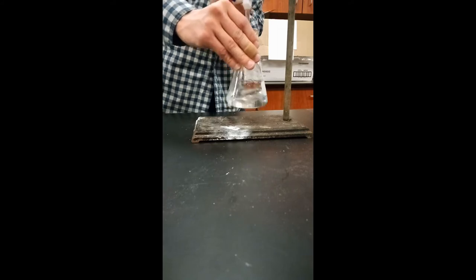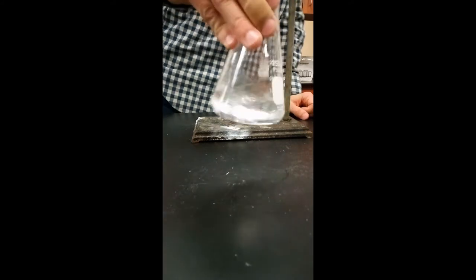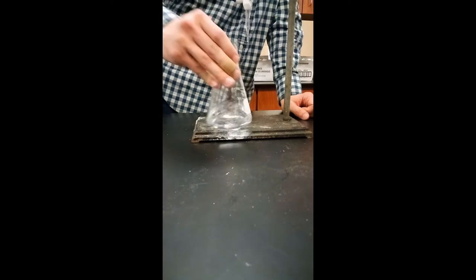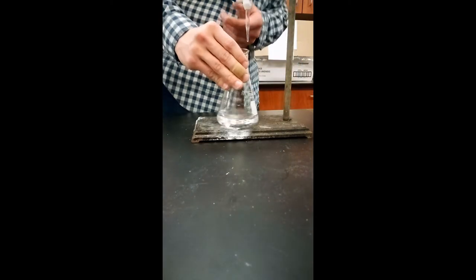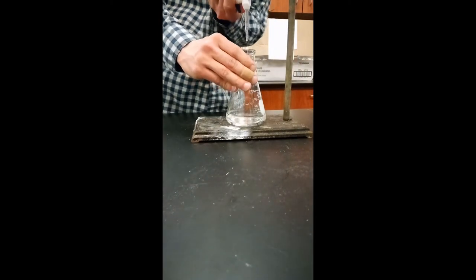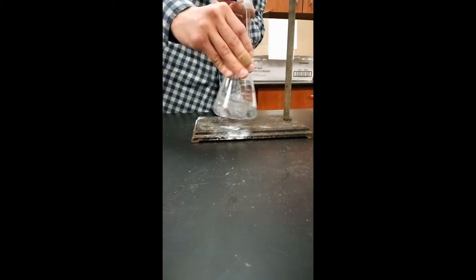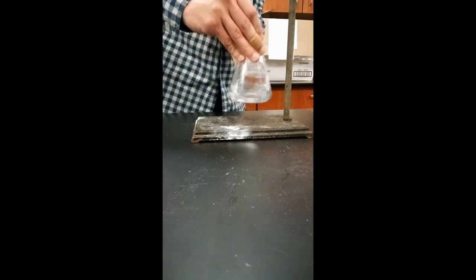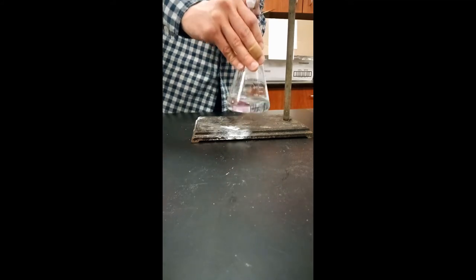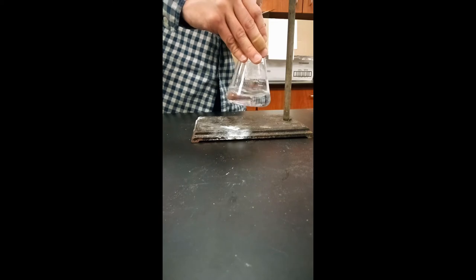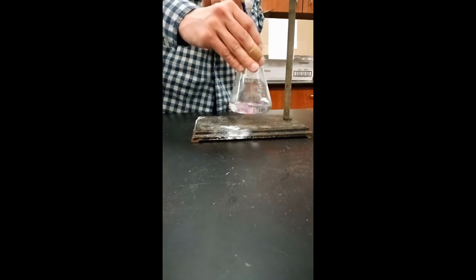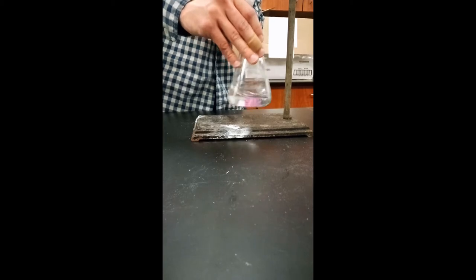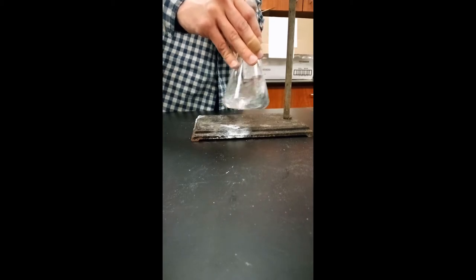Again, hopefully you can see it's still clear so we're not quite there yet. As you get closer and closer, you'll notice that it does turn pink for a split second, but then as you continue to mix it, the pink goes away. The pink will want to stay for longer and longer until you get closer. Eventually you just want the pink to stay.